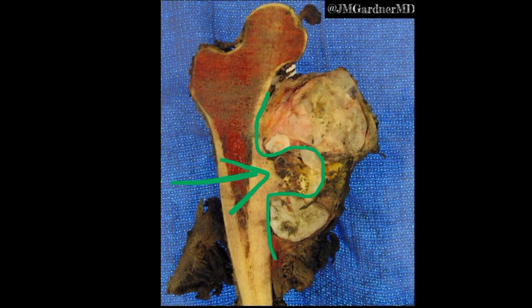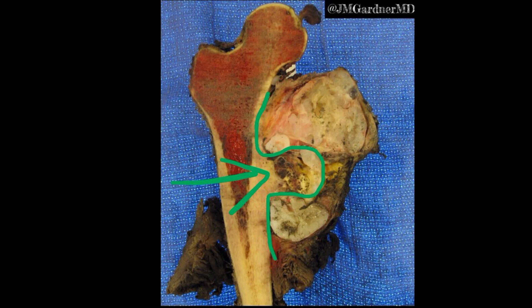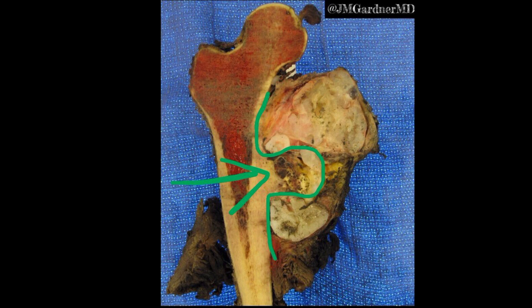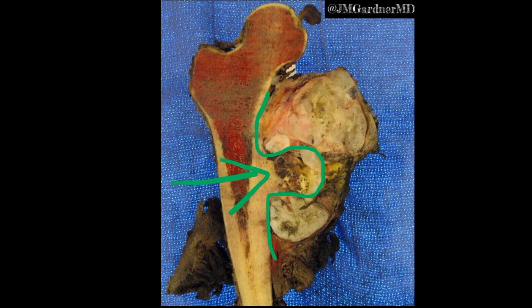We'll now take a look at another example of one of these tumors — not this case — and hear Dr. Rosenberg's comments about the histologic findings.